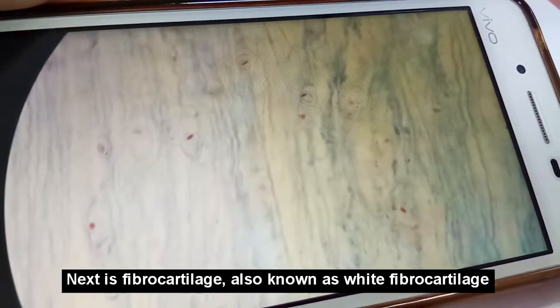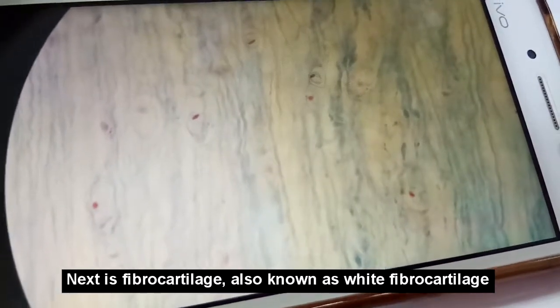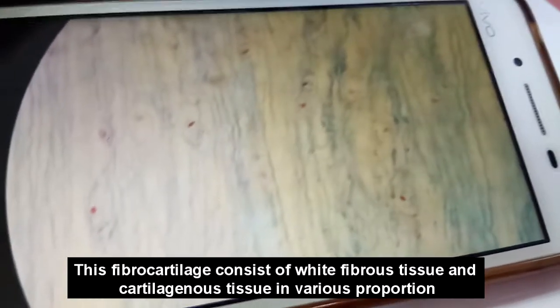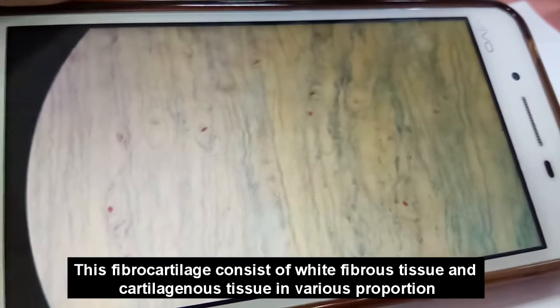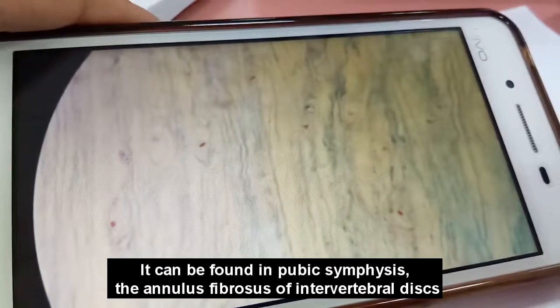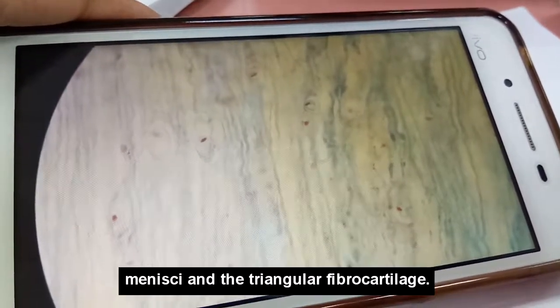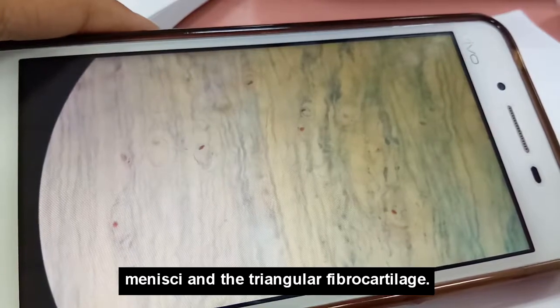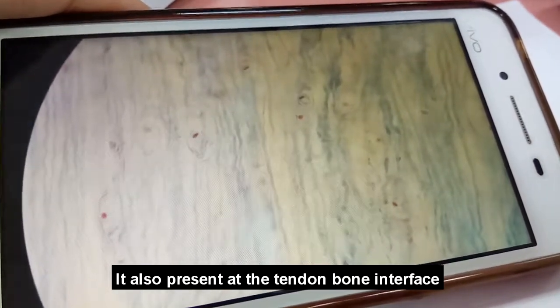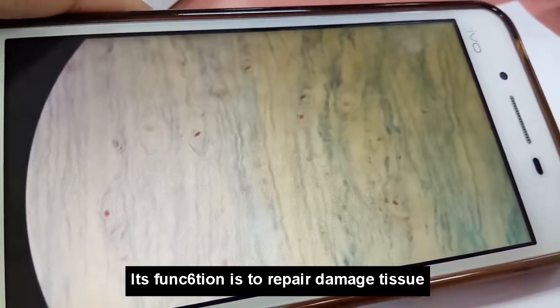Okay, next is the fibrocartilage, also known as white fibrous cartilage. This fibrocartilage consists of a mixture of white fibrous tissue and cartilaginous tissue in various proportions. It can be found in the pubic symphysis, the annulus fibrosus of the intervertebral disc, the meniscus, and the triangular fibrocartilage. It is also present at the tendon-bone interface. Its function is to repair damaged tissue.